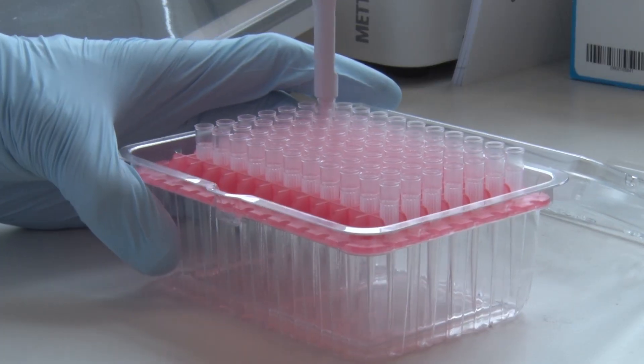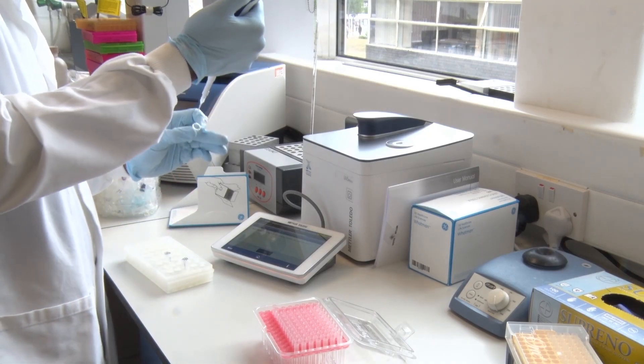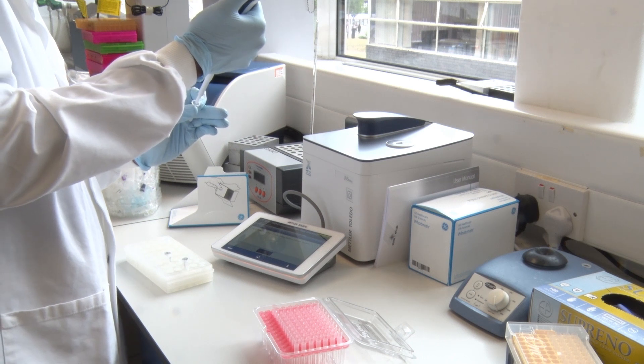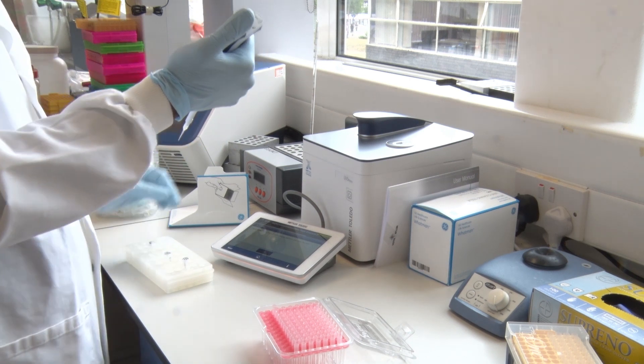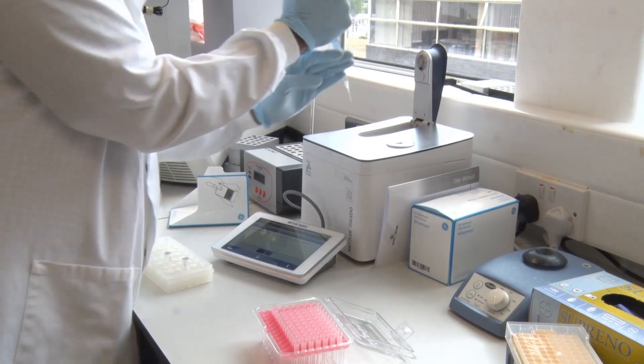We use the UV5 nano for quantifying DNA preps and also for looking at the density of our bacterial cultures when we're doing inductions — either for harvesting protein fragments for antibodies or for generating recombinant protein.